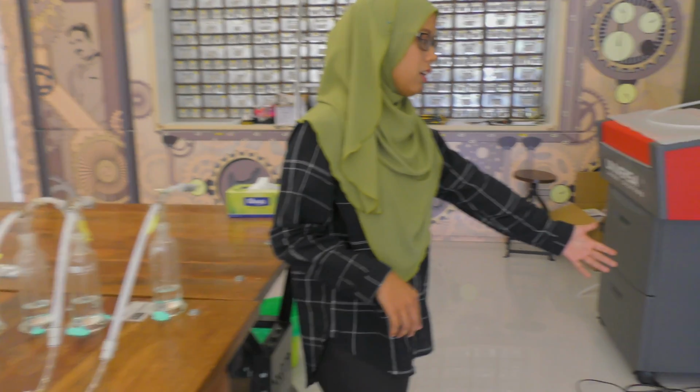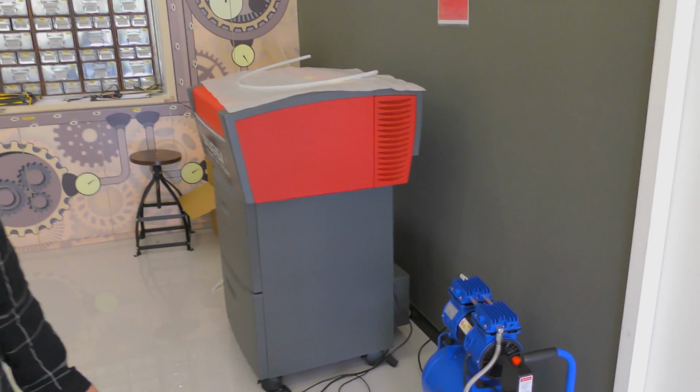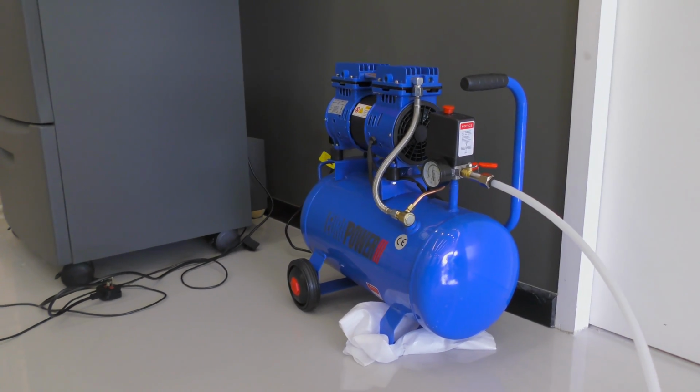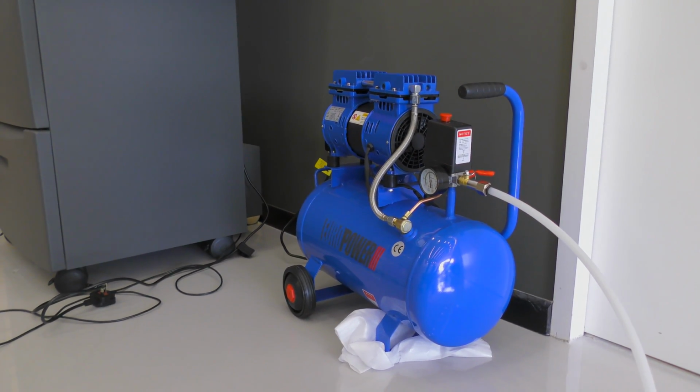Methodology of the olfactometer system. First I will introduce the components that will be used in this olfactometer system. First, we must use the oil-less piston air compressor. Why do we use this air compressor? Because we need to ensure there are no chemical smells in this system.